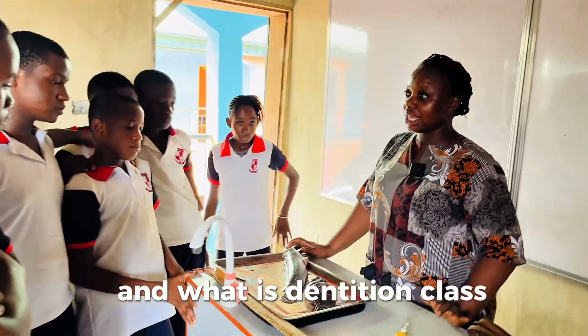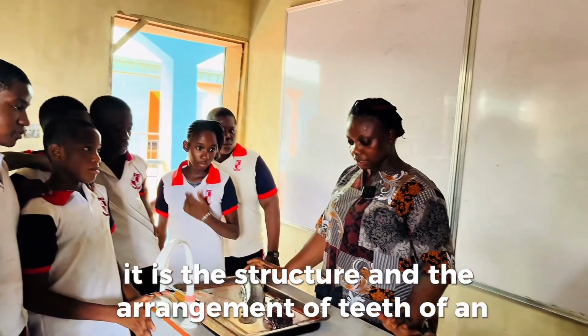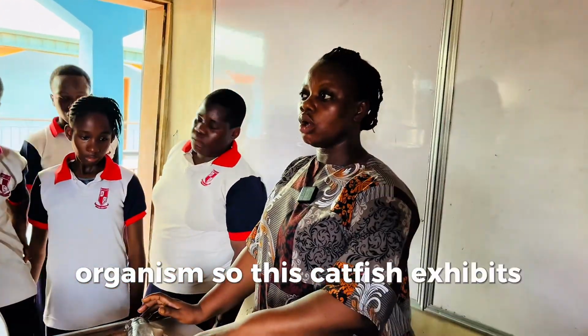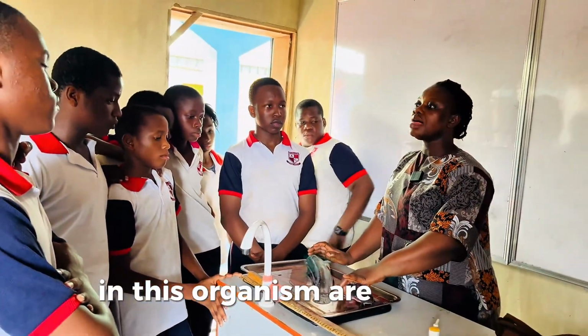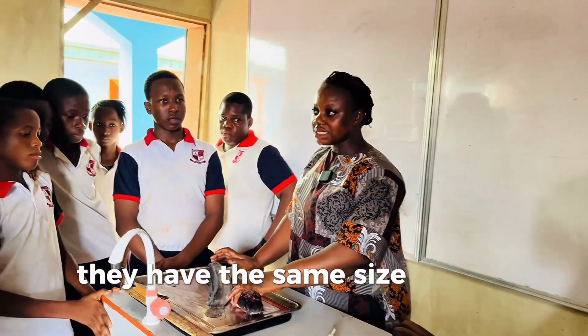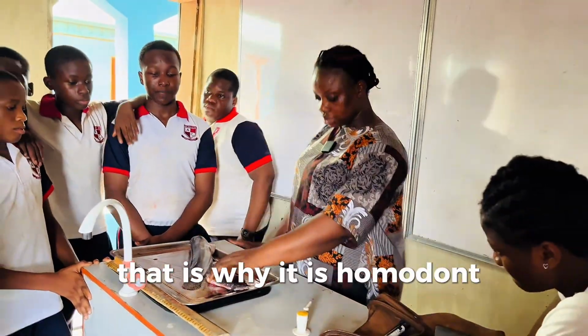And what is dentition, class? It is the structure and the arrangement of teeth of an organism. So this catfish exhibits homodont dentition. Why? Because the two sets of teeth in this organism are the same. They are used for the same purpose. They have the same size and the same shape and the same function. That is why it is homodont dentition.